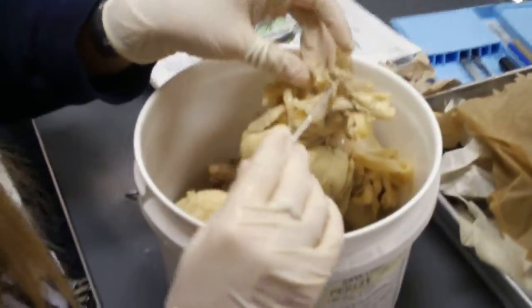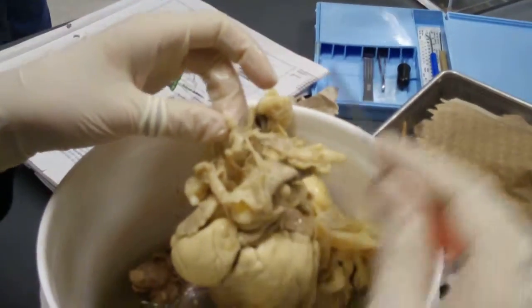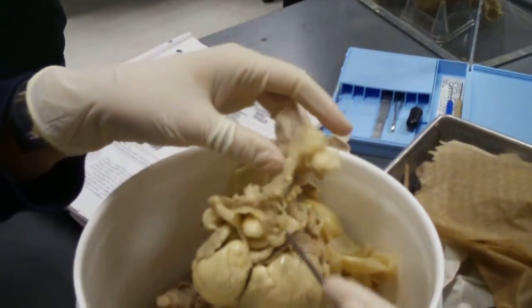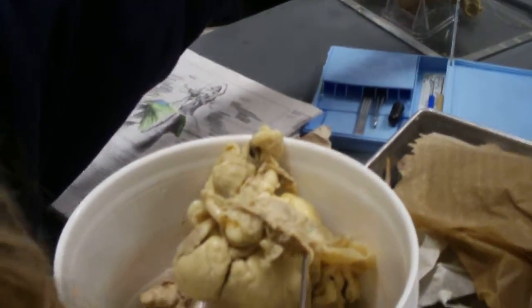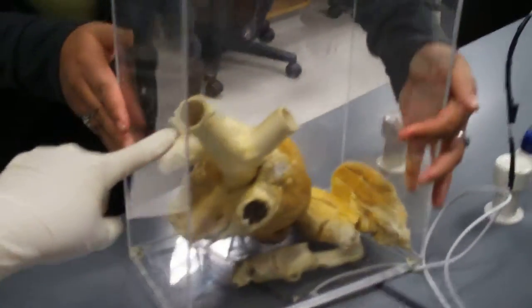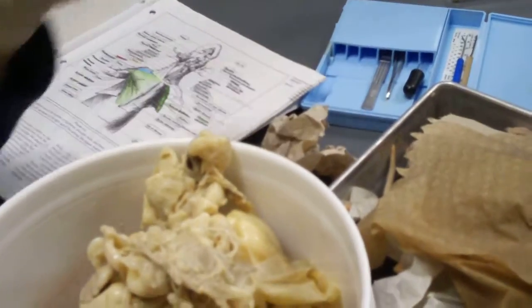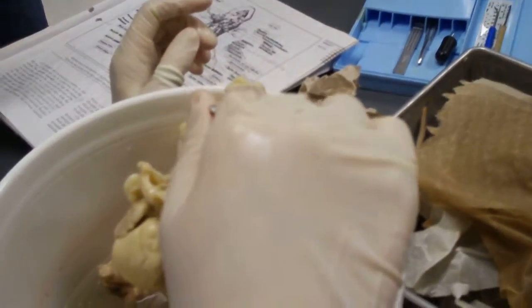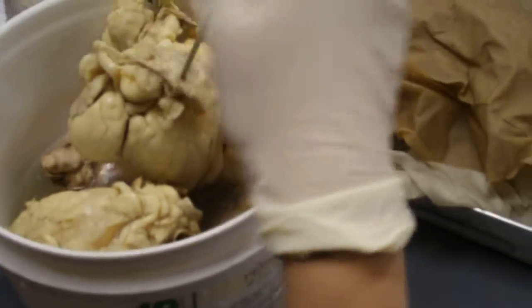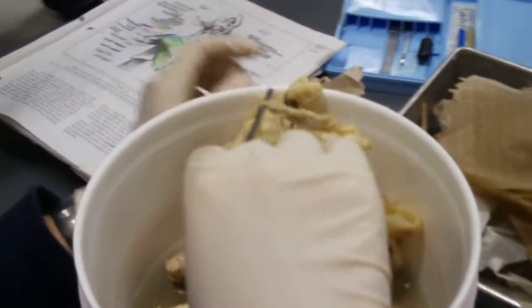There you go. Yeah, that's what it is — this is the ligamentum arteriosum. See this? Easier to see on there. Can you turn it that way? See that thing right there that's holding the aorta next to the pulmonary trunk? That connection is your ligamentum arteriosum.